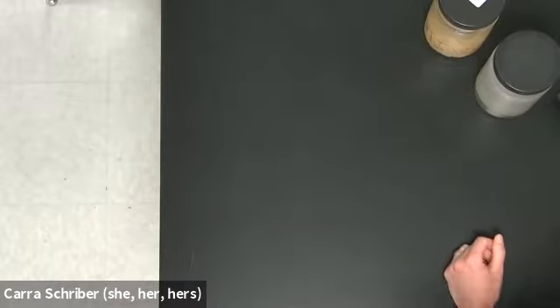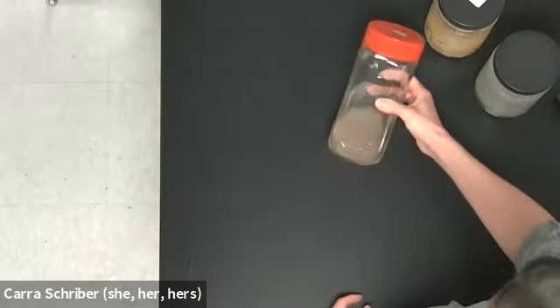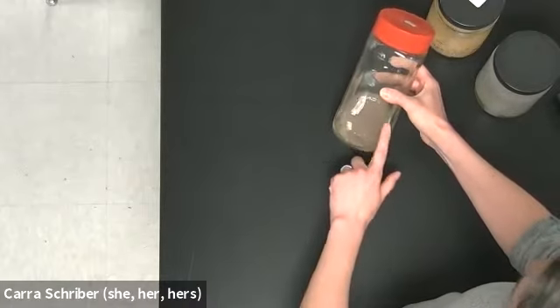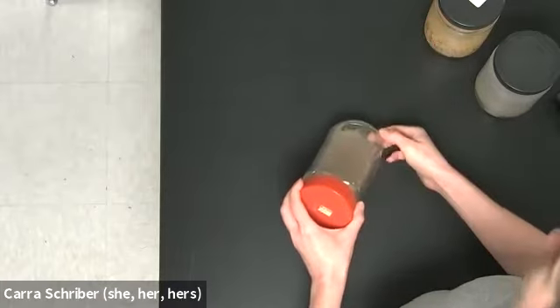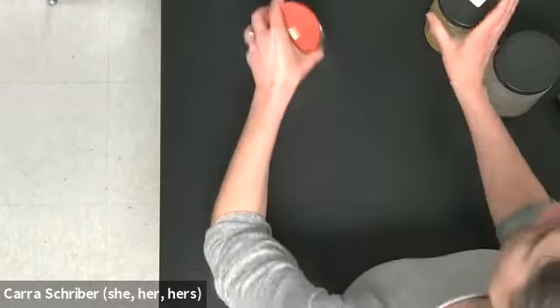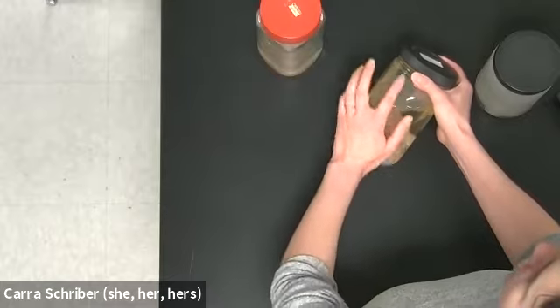Actually, that one's pretty difficult to see, so let me choose a different example. Ooh, how about this one? How about this weird one in the Nescafe jar here? So if I tip it back, oh, it's kind of going with it, but you can see the top. What you're seeing is the top, or the bell part of it, okay? And then if I tip it back, what you would see is some tentacles down here at the bottom. So each of these are different examples or specimen of the medusa form, right?